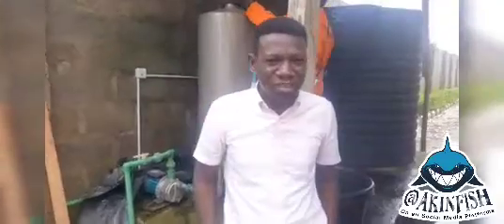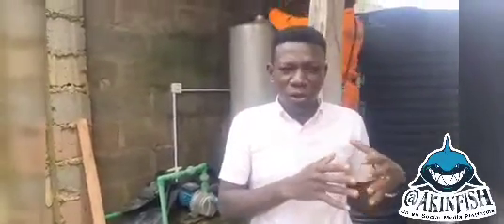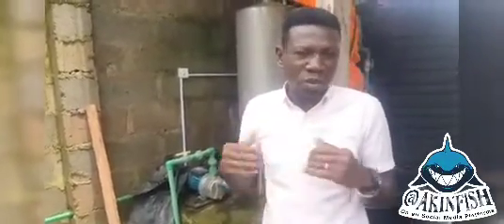My name is Akin Fish and we are here treating the water treatment plant. Alright, so you can see the cylinder behind us. We have some complaints in the farm. We have looked at it, we've done a test and we're about to start treating it. So we're going to take some water samples and we'll show you how we conduct our test of our water samples. So please come along with me.